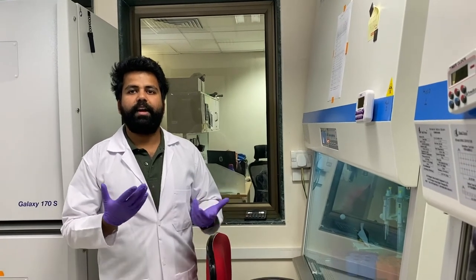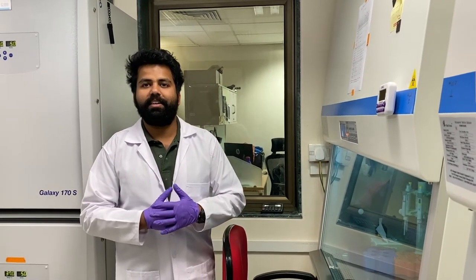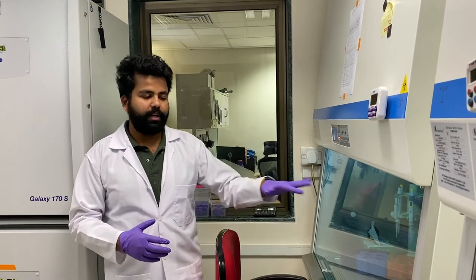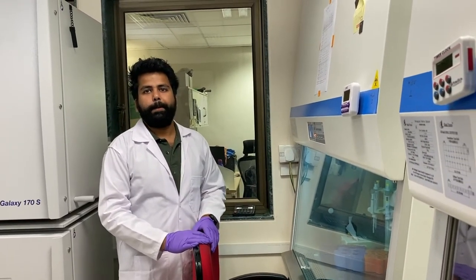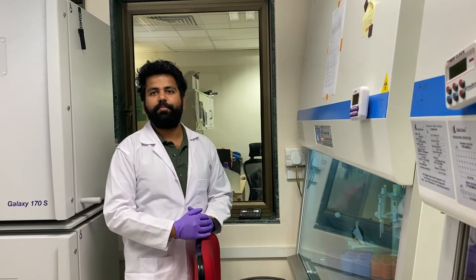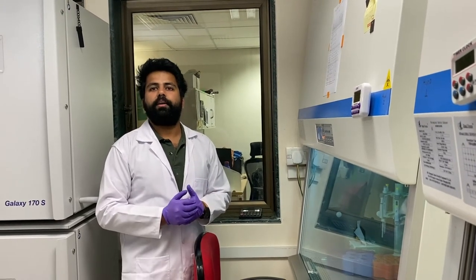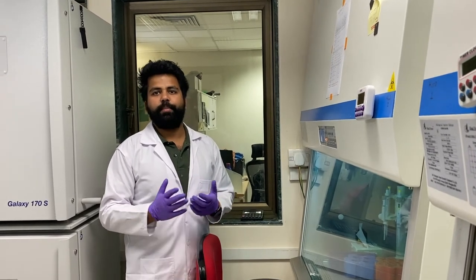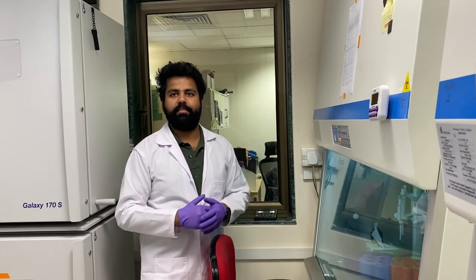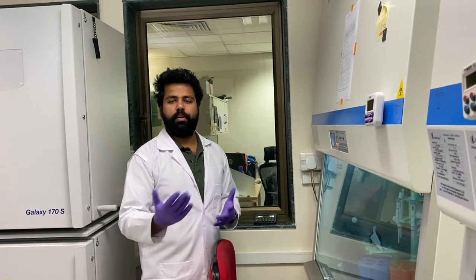UV acts as a killing agent — similar to how we are taught that if we are hit by the sun's UV light we could die. We also use 70 percent ethanol solution, similar to how people use sanitizer nowadays. It acts as a disinfectant and kills any microorganism that might be on our hands or surfaces.